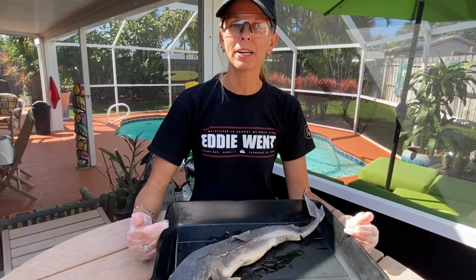Everybody, welcome to the shark dissection. We are going to do our external video first, and then I will do an internal where we'll open up and see all the different body systems.